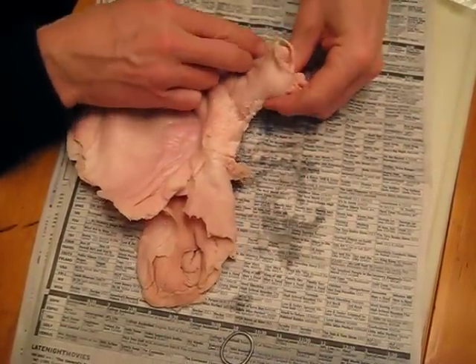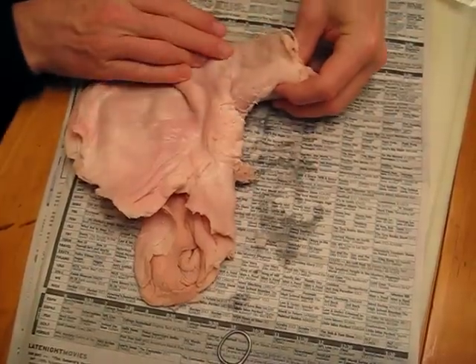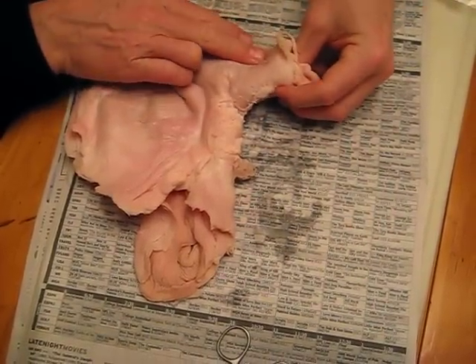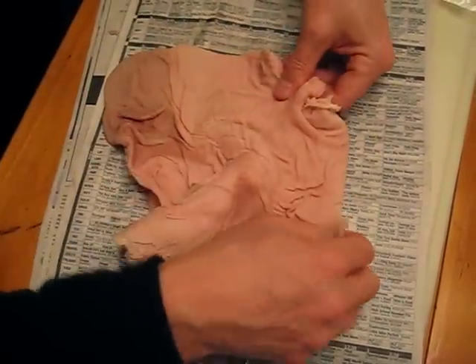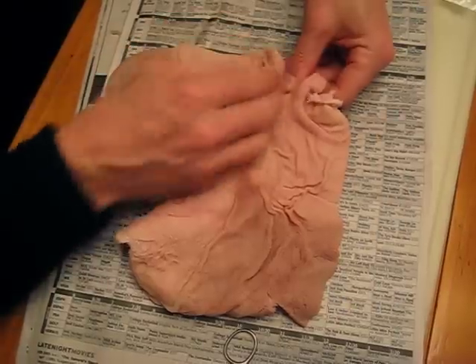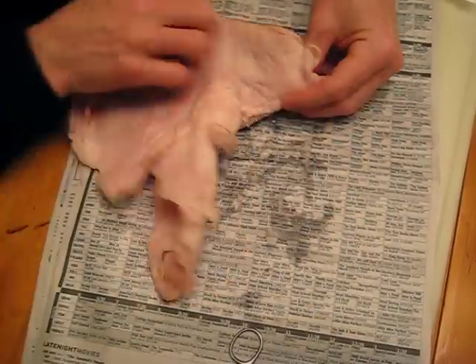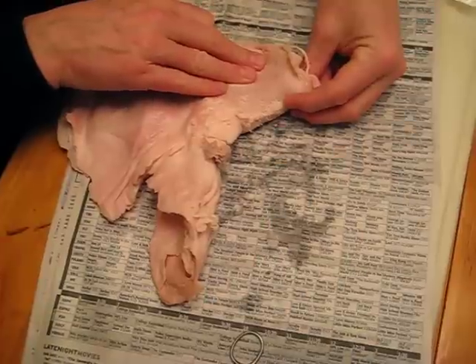You can think of the stomach as being closed like this. Food exits through the pyloric channel, and this is the antrum of the stomach. Food is going out this way — this is part of the valving mechanism that sends it out.